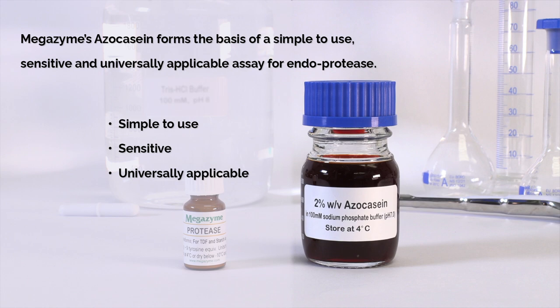Megazyme's azo casein forms the basis of a simple to use, sensitive, and universally applicable assay for endoprotease.